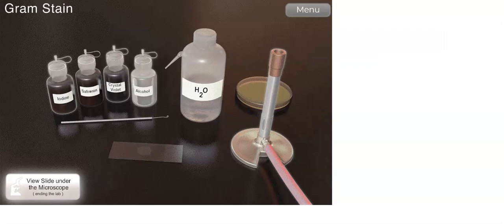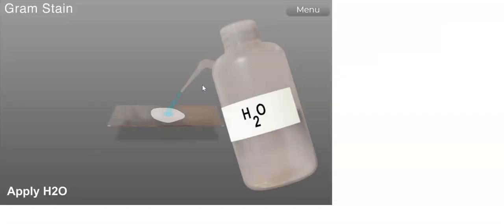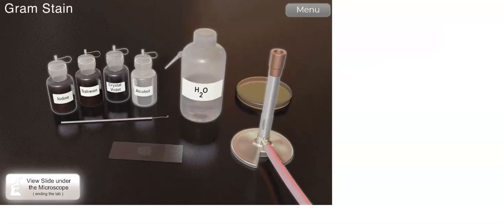The complex that we call the crystal violet iodine complex is formed after the crystal violet and iodine staining process. And then we rinse off the excess alcohol with water. The alcohol that we use here is ethyl alcohol, known as ethanol.